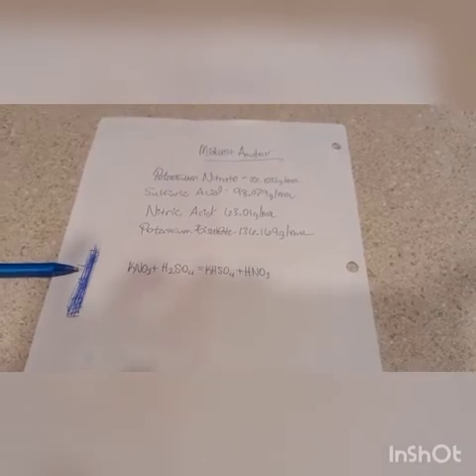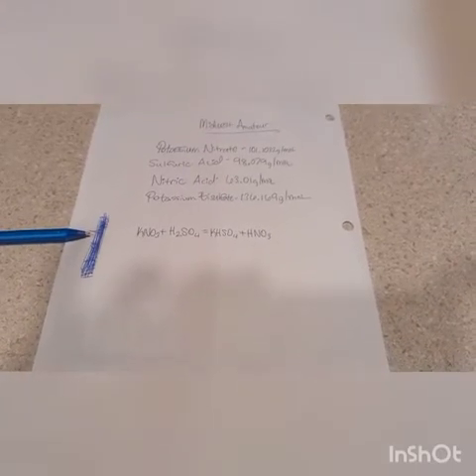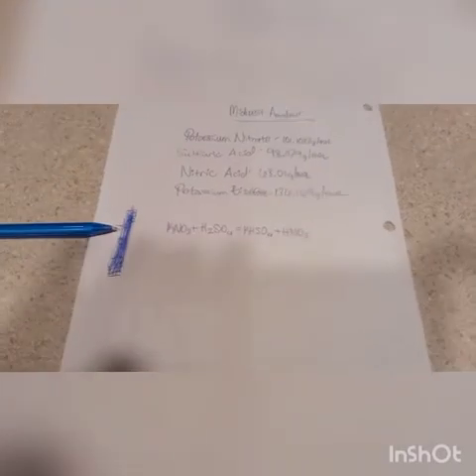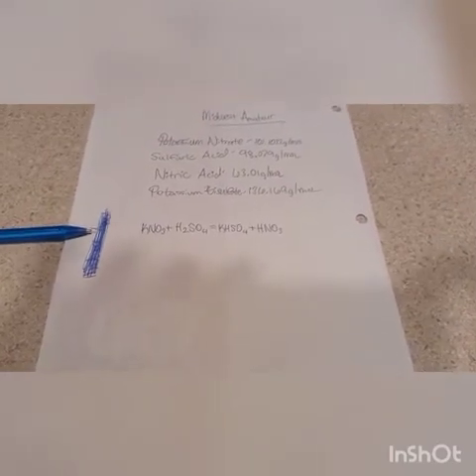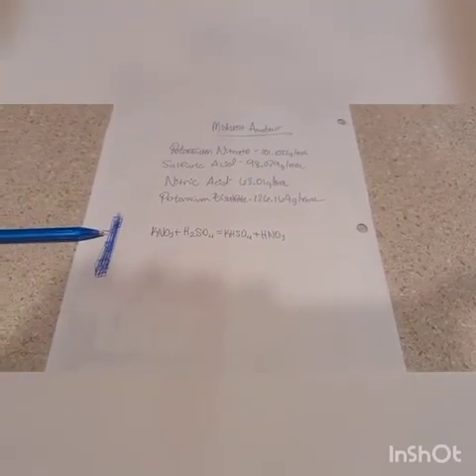So as the nitrogen dioxide is produced, you will start to get distillate that will start absorbing that nitrogen dioxide. Your nitric acid will be contaminated with it, so mine is still kind of yellow, but you can redistill it. And you can also use peroxide, I've heard. Haven't tried it, don't really care. For me, the nitrogen dioxide doesn't really interfere with the reactions that I do. So we're going to go ahead and get started, show the clips, and then I'll show my results, and we'll kind of go over everything.